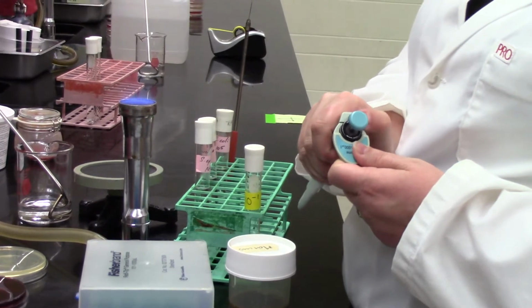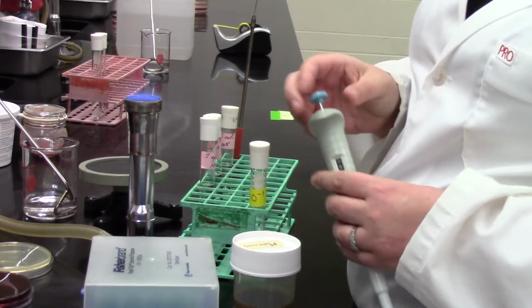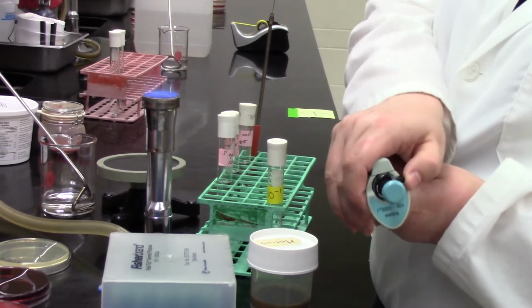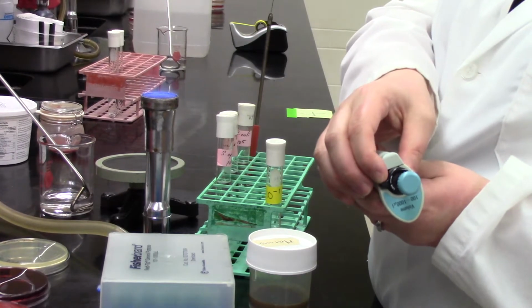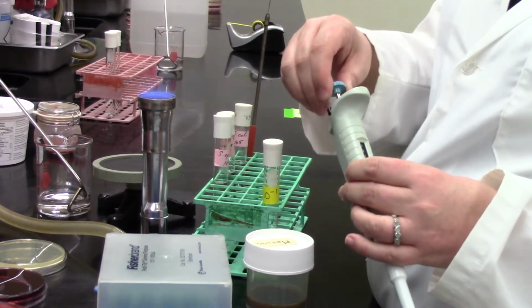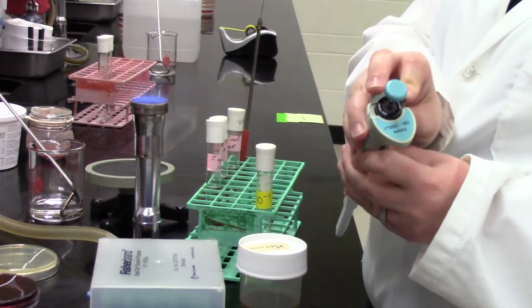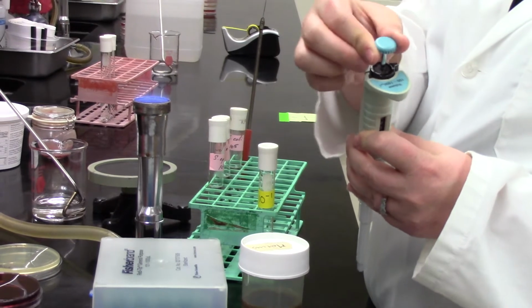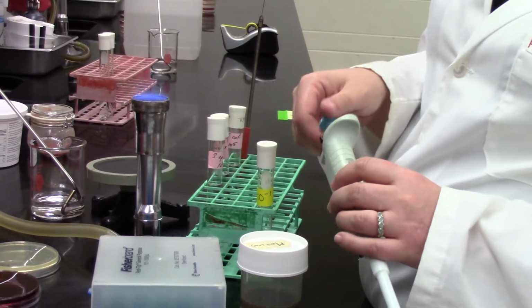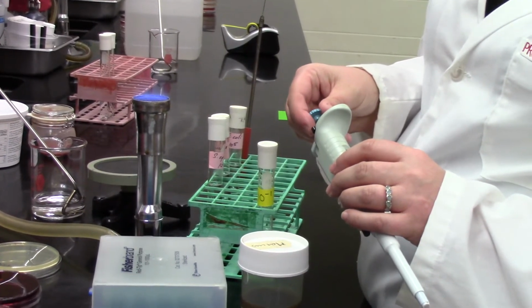She is working with the micropipetter that you've just learned about, and what you saw her do there, maybe I'll have you do that again one more time, and I'll just zoom in. See how that black switch is moving from one side to another, from the closed form to the open form? That's going to let her adjust the measurement. She needs to move it so that she's pulling up, in this case, 1 ml of our plant juice.